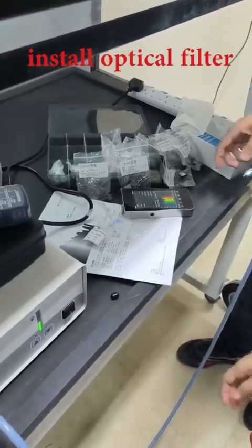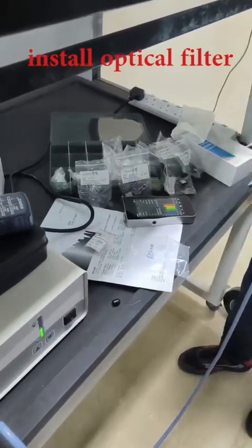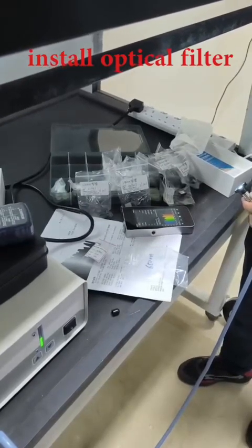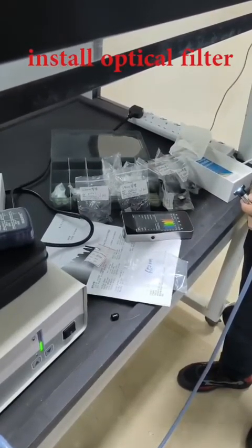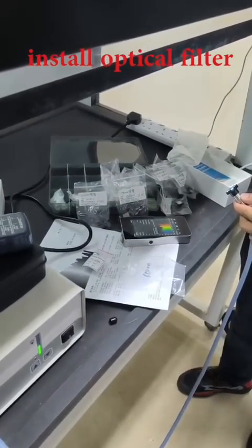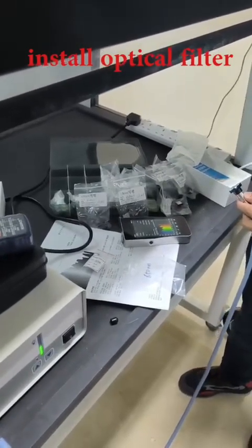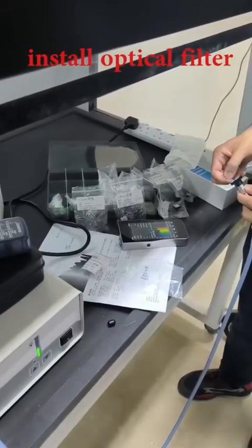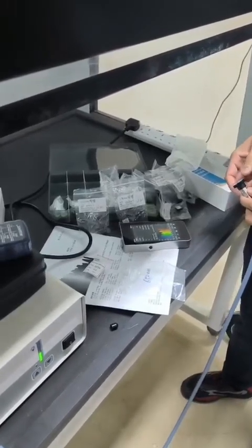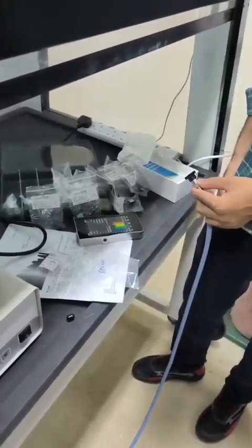420 cut means from 420 to 780. Normally, the optical resource provided is 380 to 780. Below 400, some researchers see it as belonging to UV, so sometimes they will ask you to cut the UV. At that moment, you can use this 420, cutting the part below 420 to leave 420 to 780, which is pure visible. So this is a range cutting, not a sub cutting.